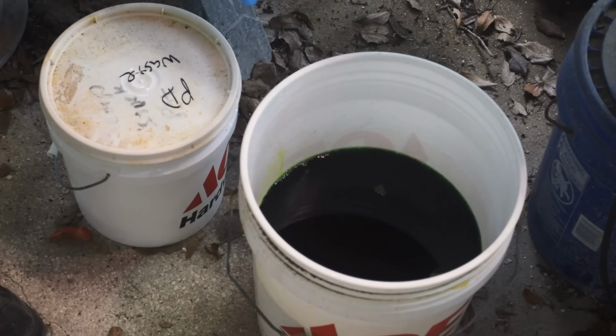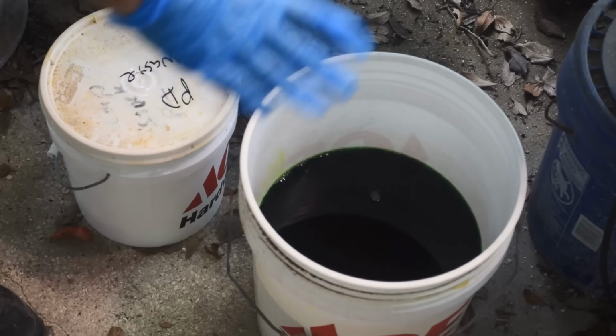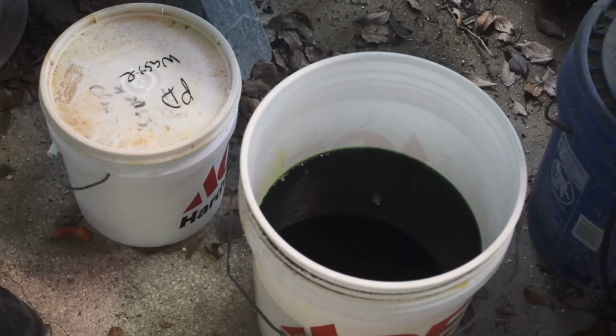I'm going to throw a couple spoonfuls of SMB in there just to help promote any gold to settle out in the bottom of the temporary stock pot. And the next time I empty it out into the main stock pot, I'll just capture the solids in the bottom of it on a filter and process it.